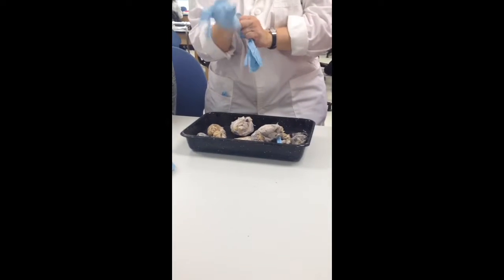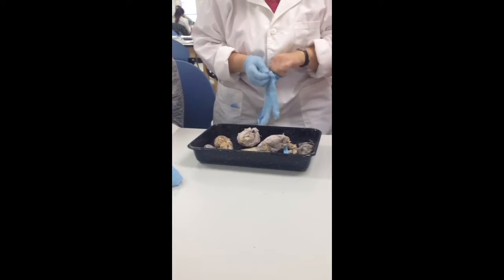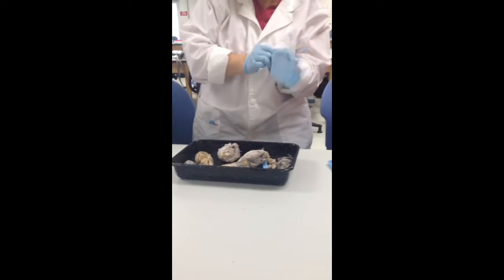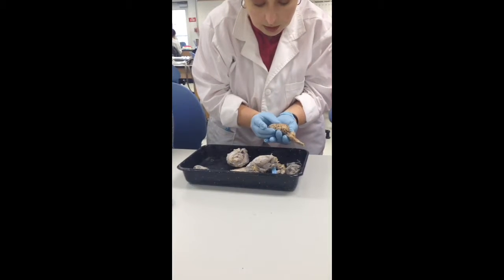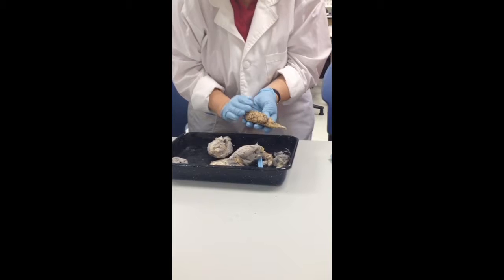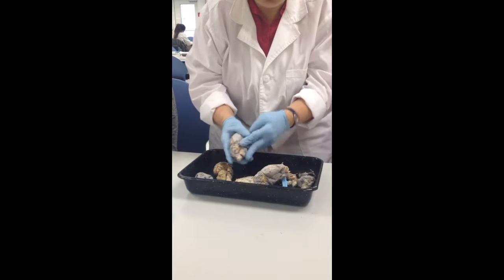Osteogenic layer, the inner layer is the meningeal layer. What layer is that black webby layer? Arachnoid. Arachnoid layer. Good. And as you peel those back, then you get to the layer that is closest to the surface of the brain, and it makes the brain look a little shiny. What layer would that be? Closest to the surface of the brain? Pia. Okay, pia.